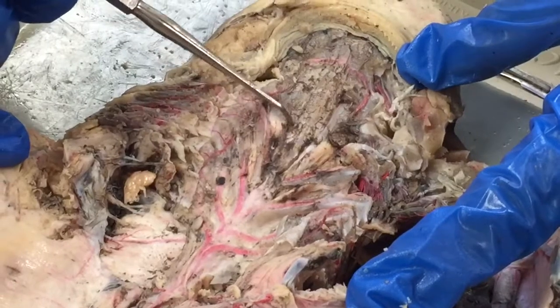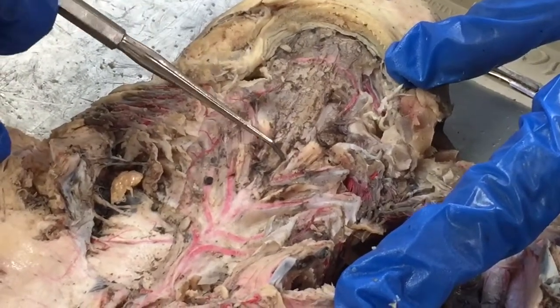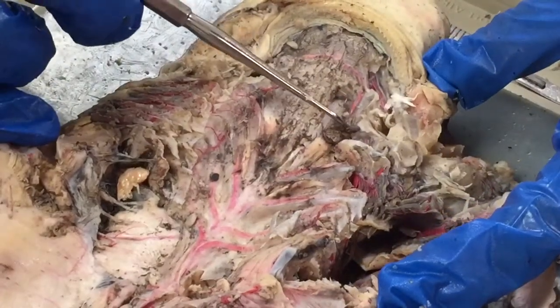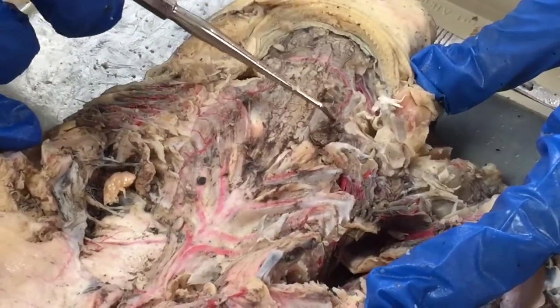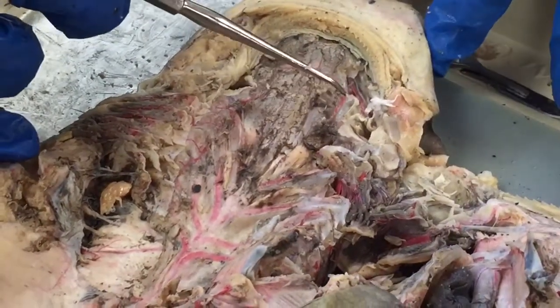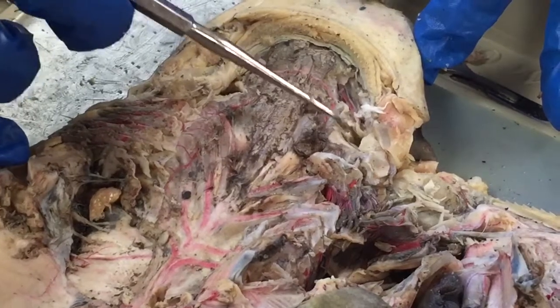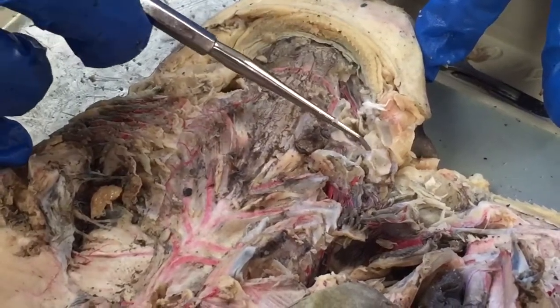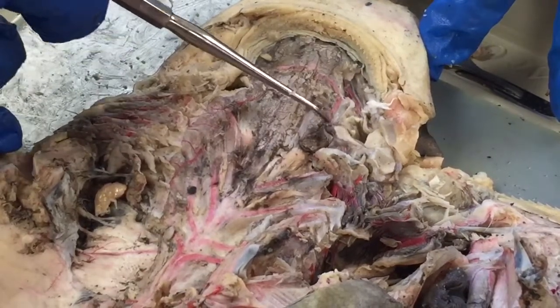This specimen isn't ideal, but the dorsal aortas are really small and run up like this. Then going over from here, this is our hyoidian artery here. The stapedial artery branches off here just above the spiracle.